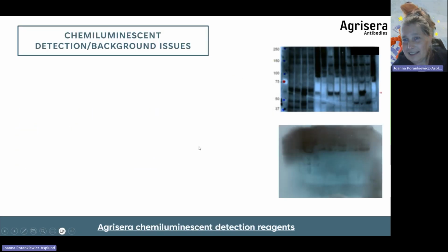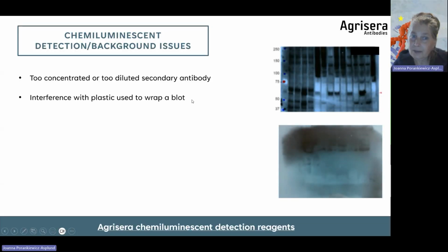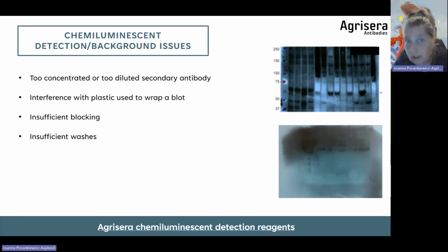And with advantages, there also come problems. You may have seen these types of blots done with chemiluminescent detection. And here I will walk you through what can be a reason for this background. So as I mentioned a while ago, too concentrated but also too diluted secondary antibodies. So please read product information sheets before you choose the dilution of your primary or secondary antibody. Interference with plastic used to wrap a blot is actually very common because that can give you interference and background signal. Insufficient blocking, as you saw in the former slide. Insufficient washes also. So please stick to your protocol and apply washes with volumes and time as in the protocol.